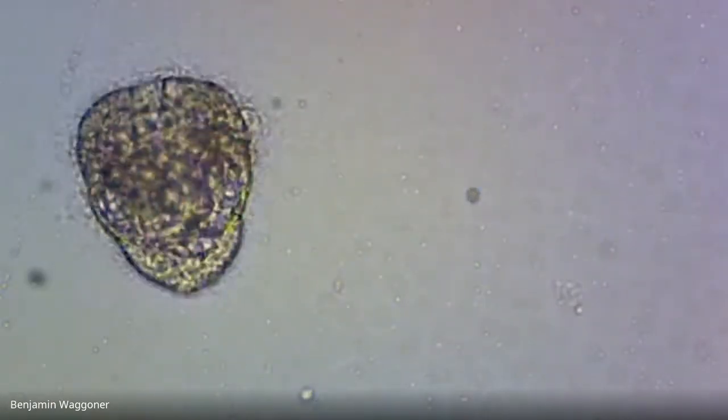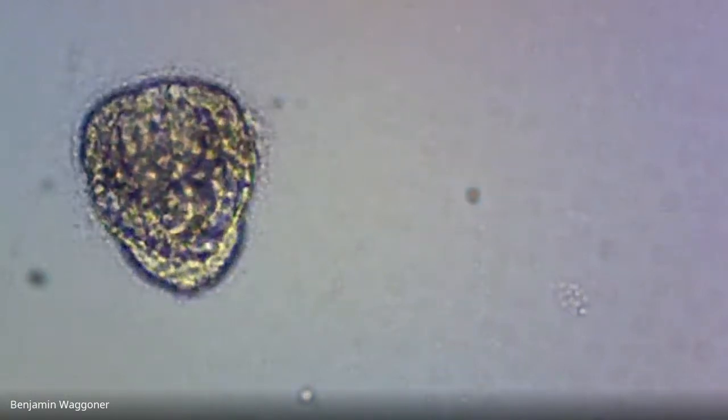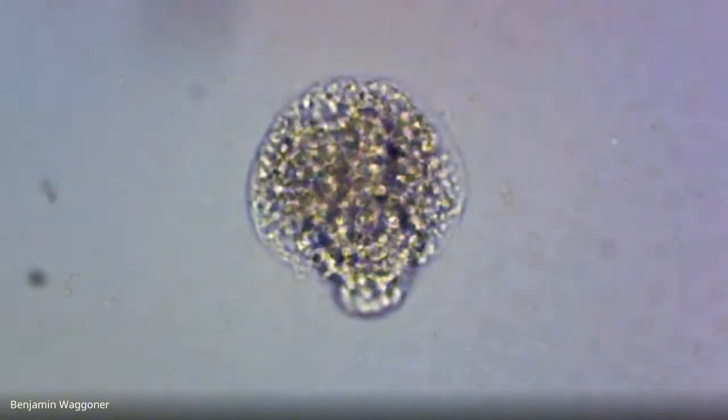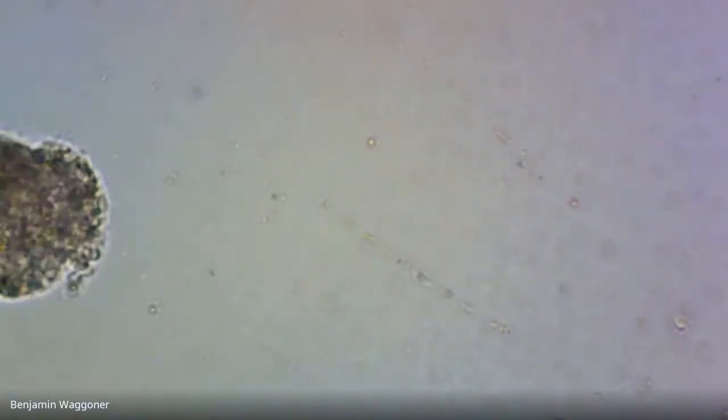There's some others I'm just passing through just because they look so awful. That one looks like it made it to the prism stage, although again, the bacteria are chowing down. That's one that just looks horrible. Maybe prism at a funky angle. And if you call that prism, I wouldn't flunk you this time.